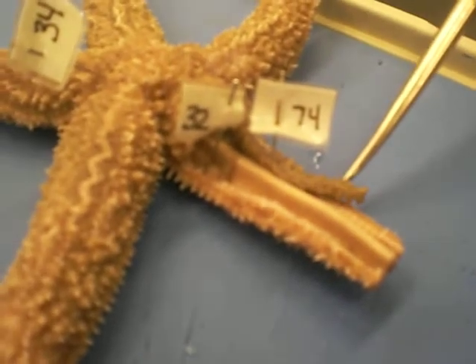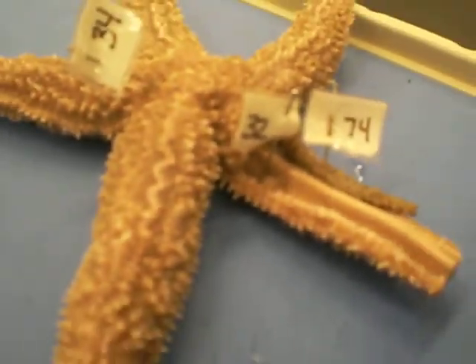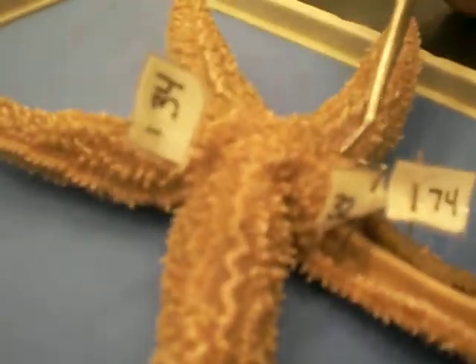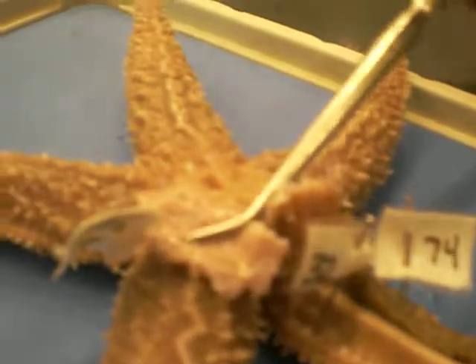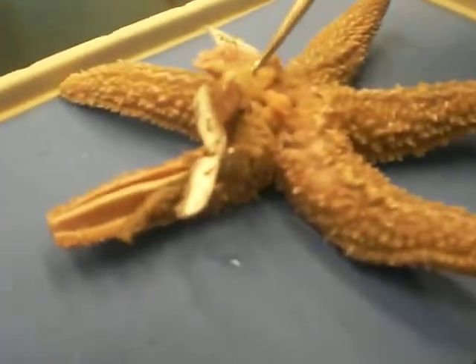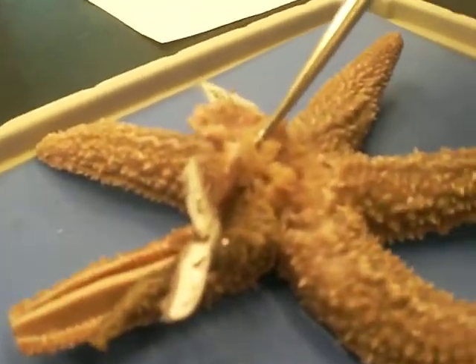These things here are the little ampullae. This is the digestive gland. The gonads. Here is the madreporite — water flows into the vascular system through the madreporite. The pyloric stomach is on top. The cardiac stomach is under.